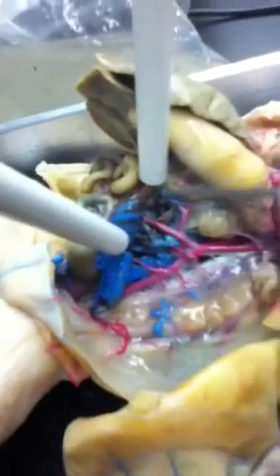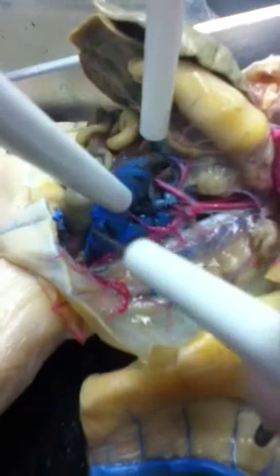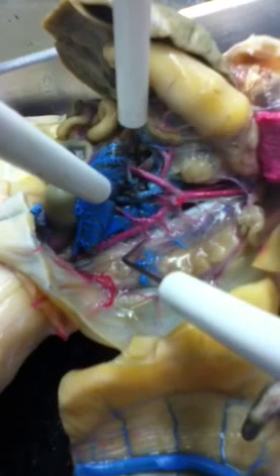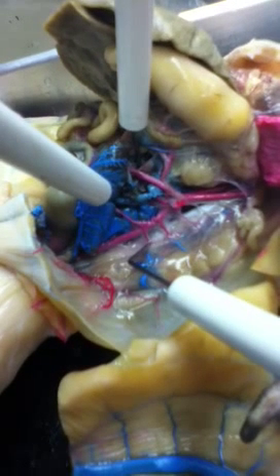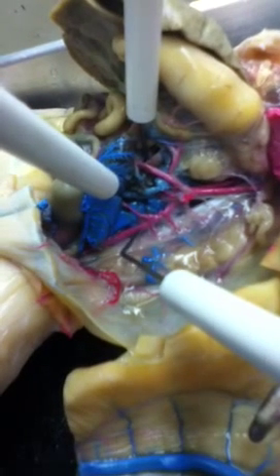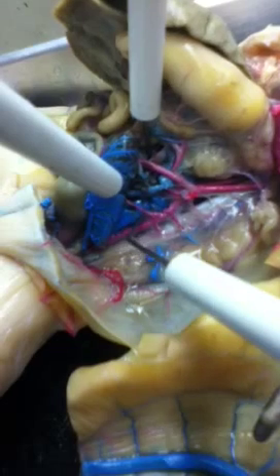Underneath the kidney itself, you have this long tube that runs all the way down — that is the dorsal aorta. Whatever arteries run off the dorsal aorta into the spine are the lumbar arteries, and the ones that run from the dorsal aorta to the kidneys are the renal arteries.